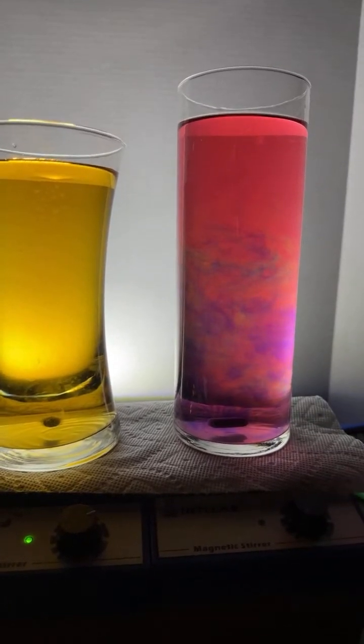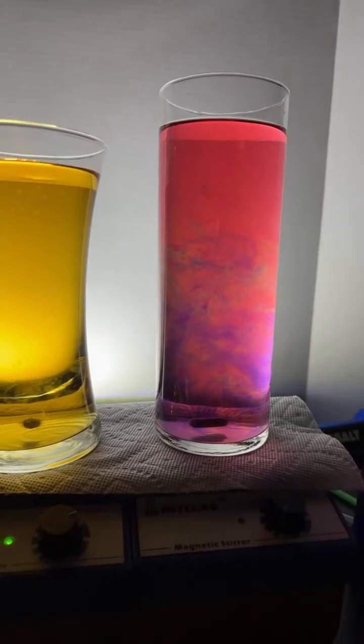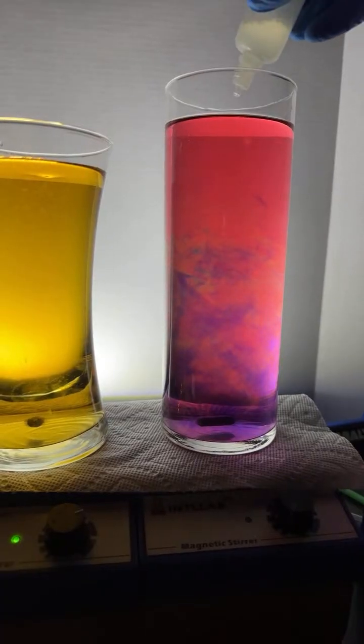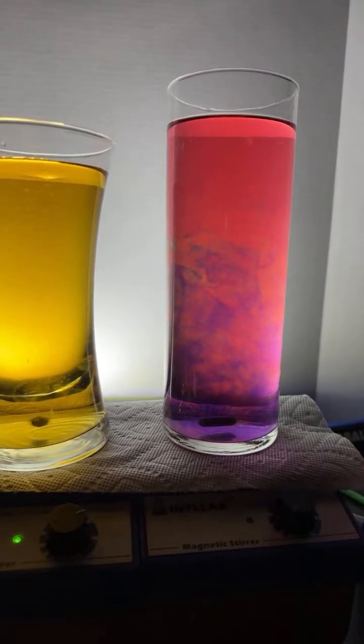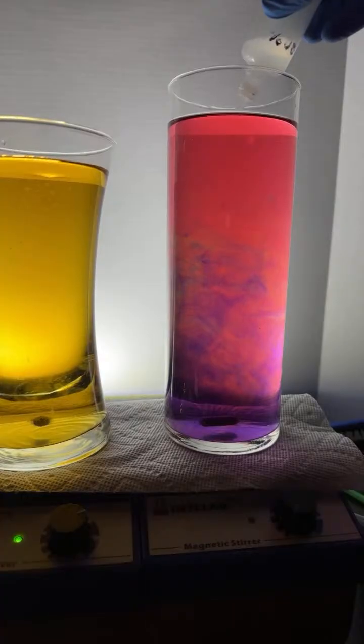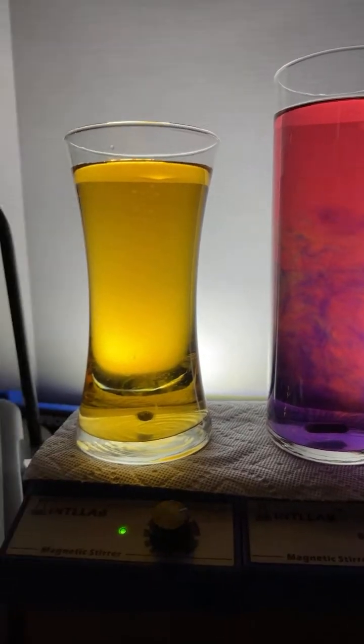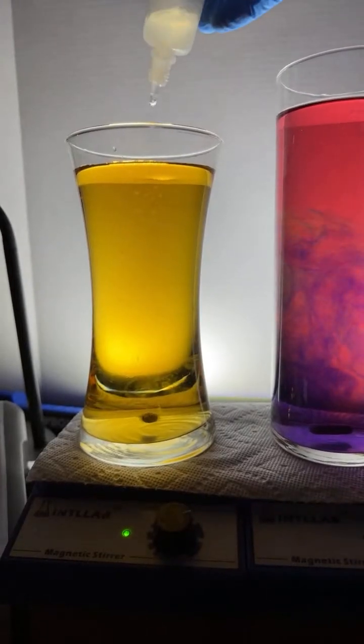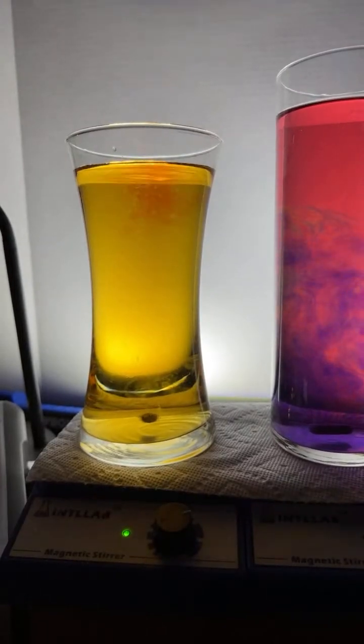I think I'm going to add another drop of base over here. I think we might get the pH gradient. The left one red, Amy Watkins, is for you. Oh, that's the acid. Amy wants the left one red, and Amy's going to get the left one red. Here we go. 1, 2, 3 drops of acid should do it.